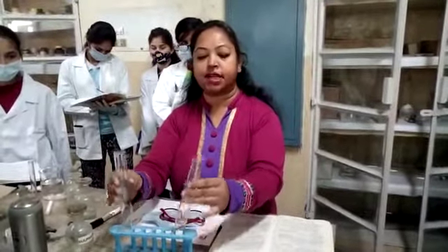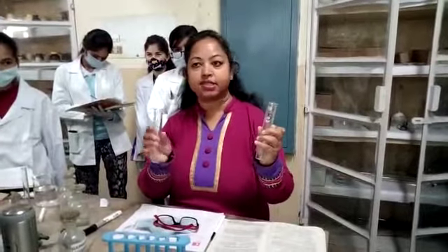Good afternoon students. Today we will perform the limit test of sulfates. For that we need two Nessler cylinders — one is marked as standard and another is marked as test.